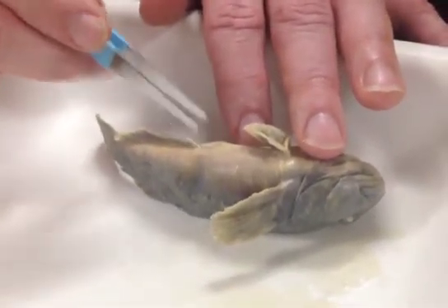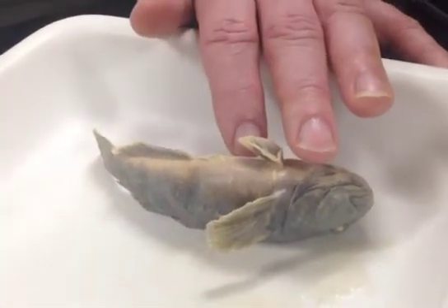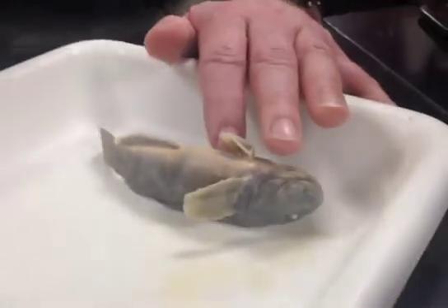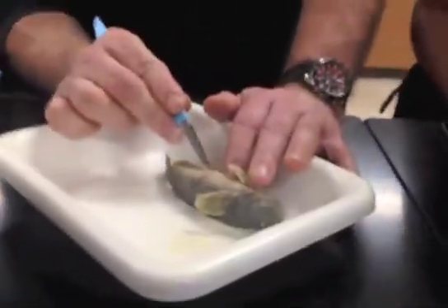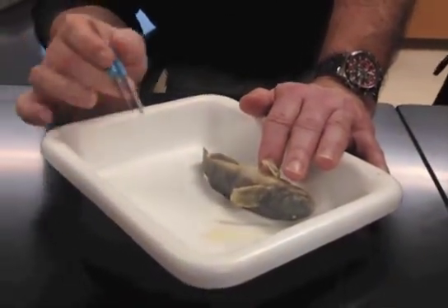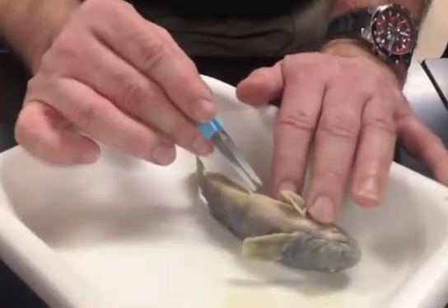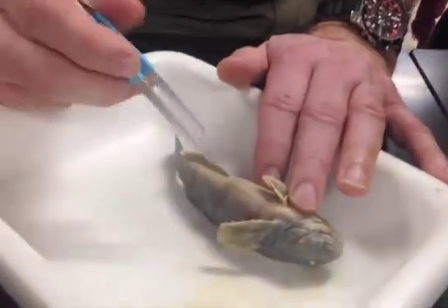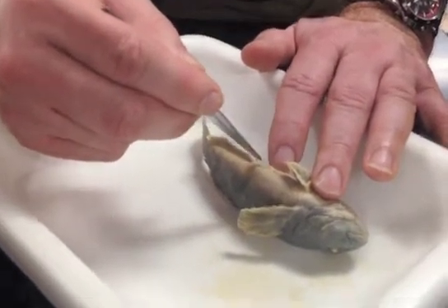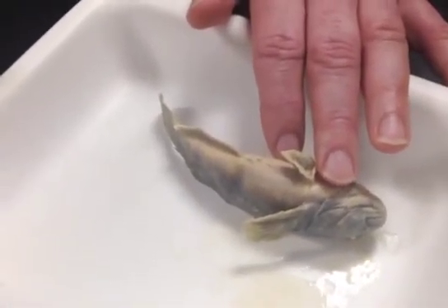The female's tube is broad and then tapers. These are fish that place their eggs — the female will turn upside down and lay their eggs underneath a rock or some submerged object, shooting the egg out through that tube and placing it very precisely. Females have this kind of fat tube; it kind of looks like a flower — round with a little flat part coming out the backside.